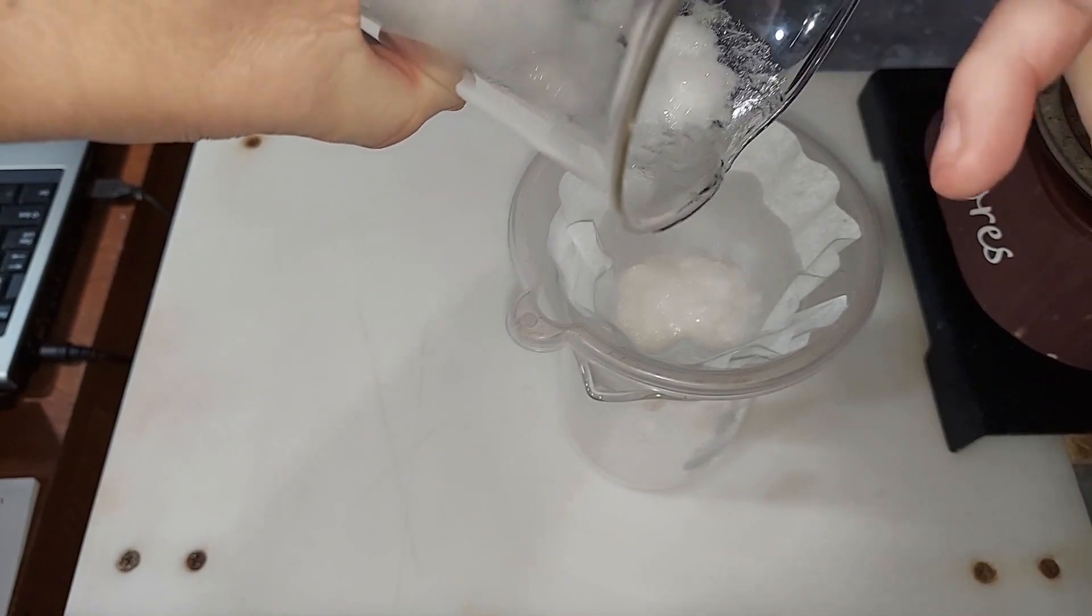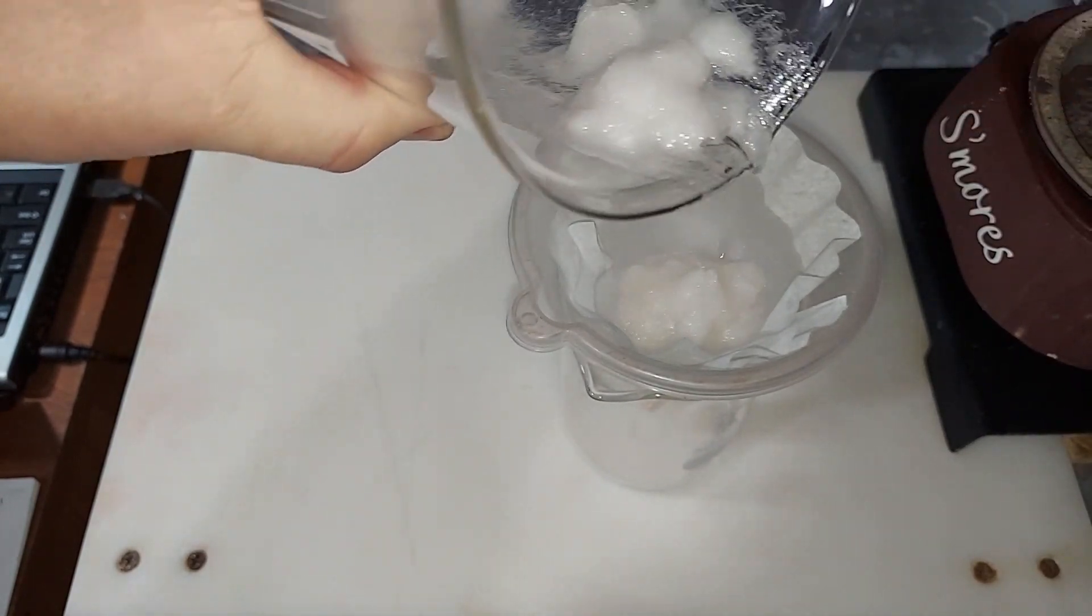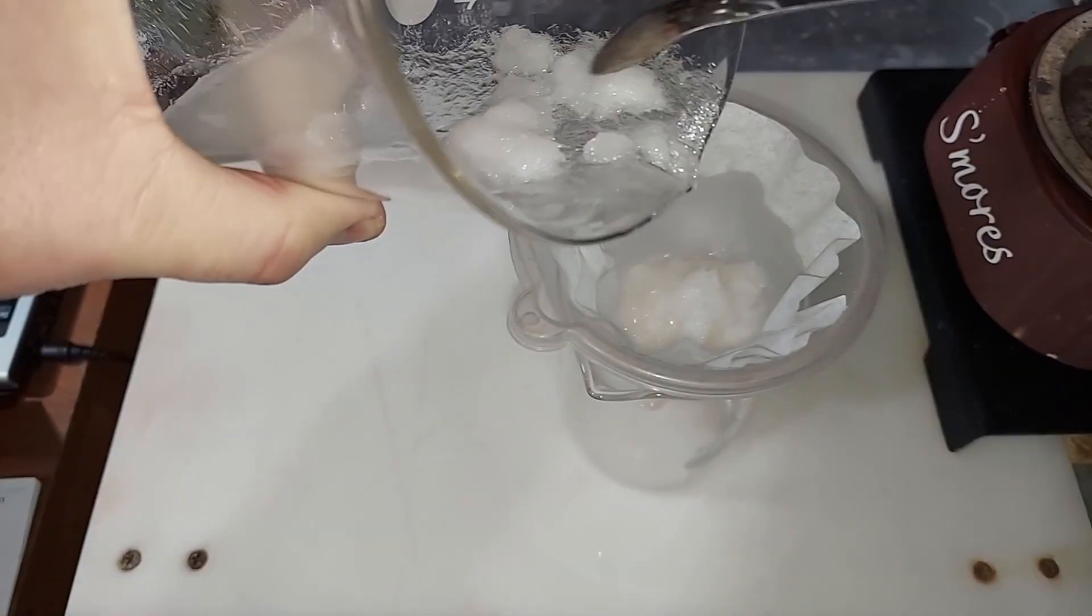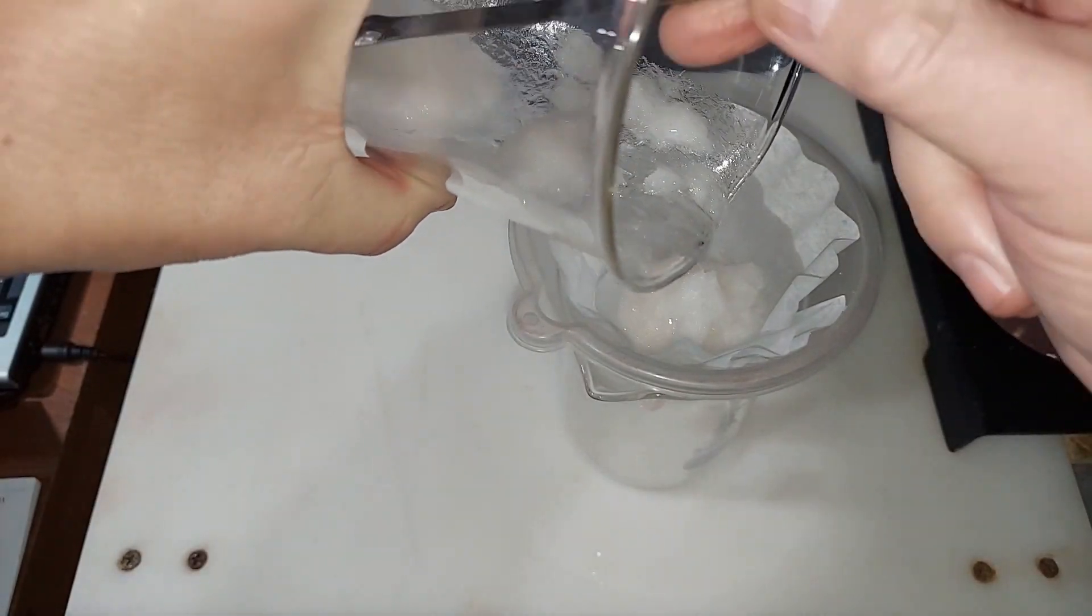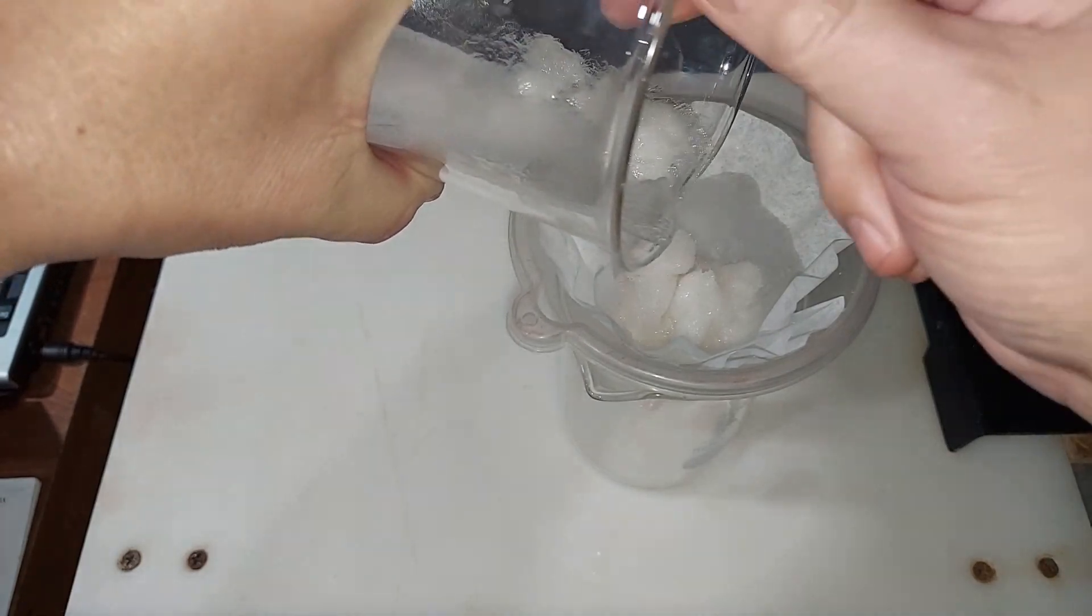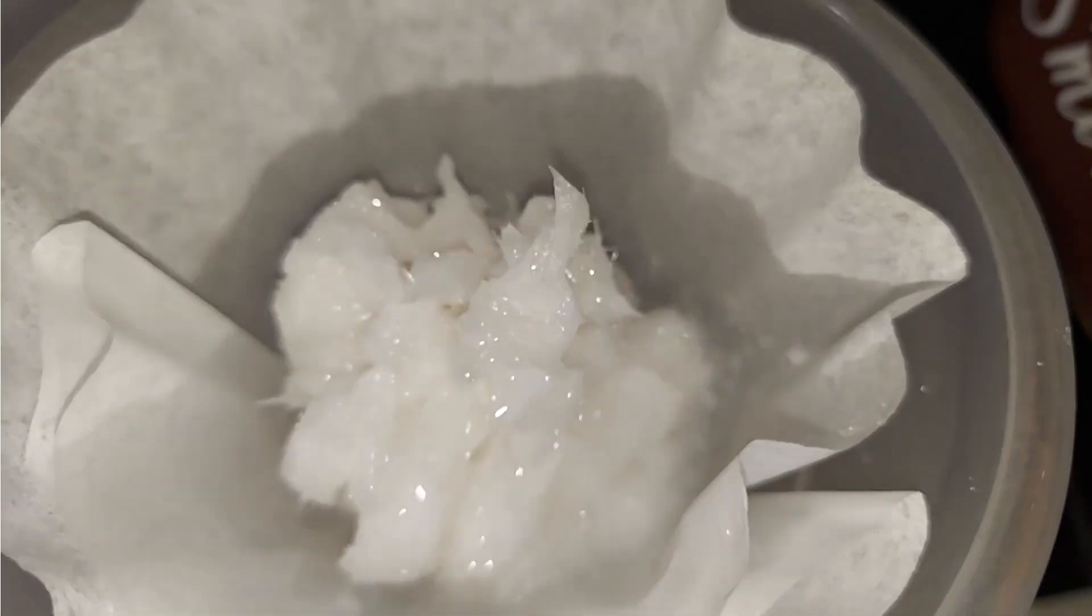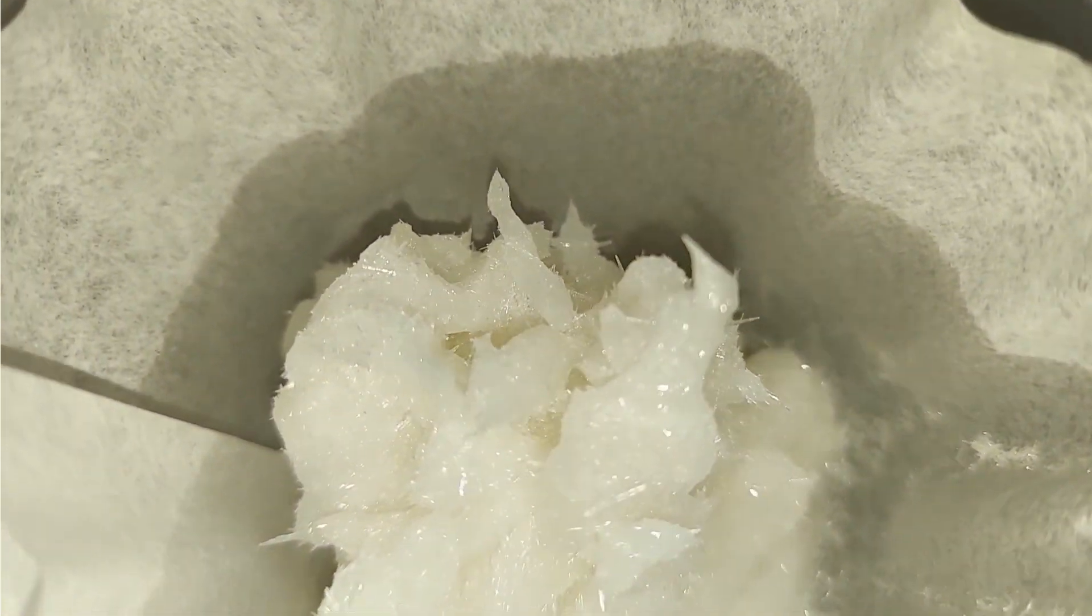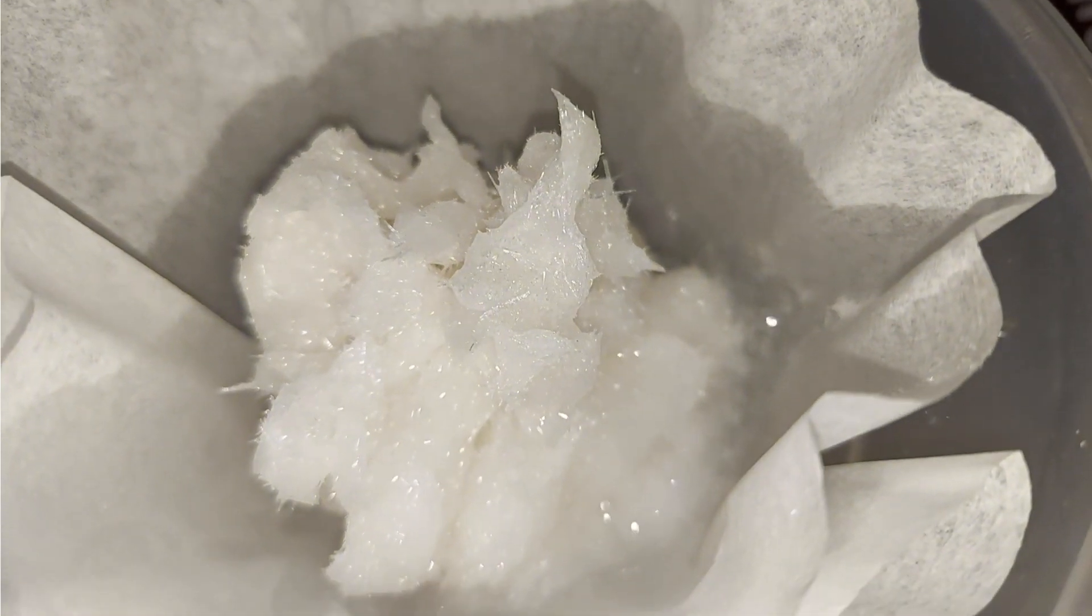Crystals are kind of cool. They're long and sharp, like needle-like. You can see that on the bottom of this. Yeah, I'm sure when it dries up you'll be able to see those crystal structures. You can see from this a little bit some of the spiky needle-like crystals that are everywhere. It's white stacked on itself so nicely like that.